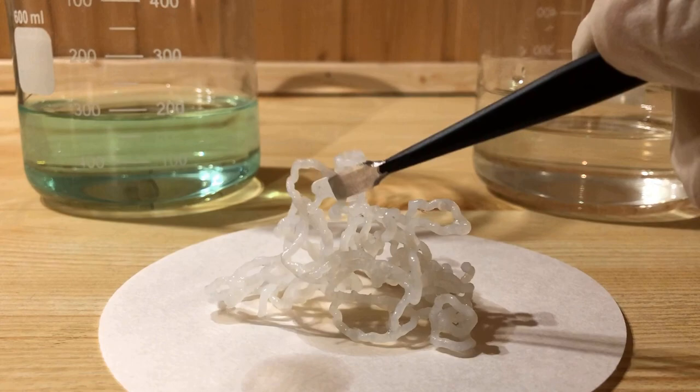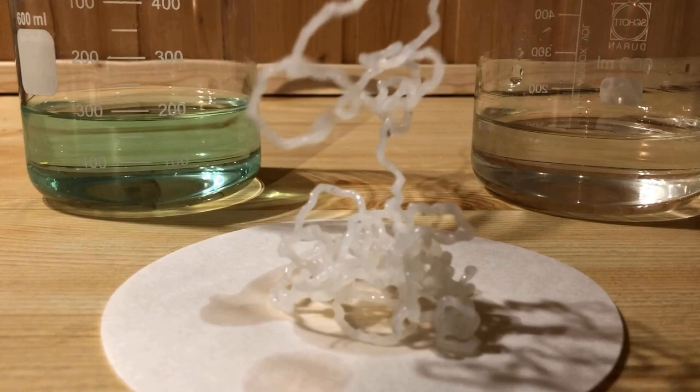Today we are making cupro, a synthetic silk. It is relatively easy to prepare and you only need a few chemicals, which are easy to get.